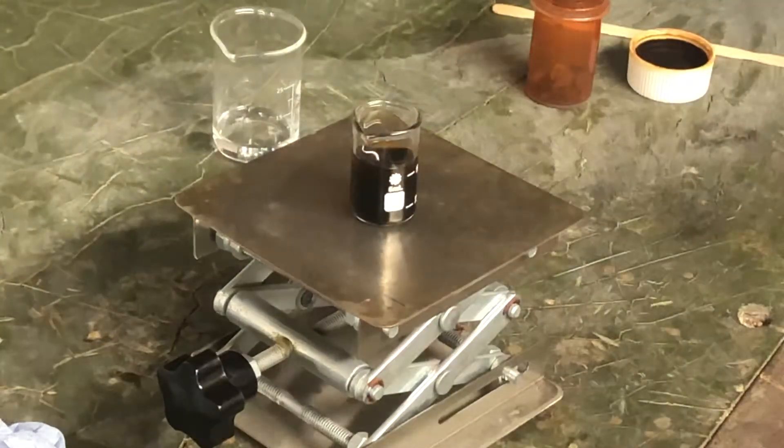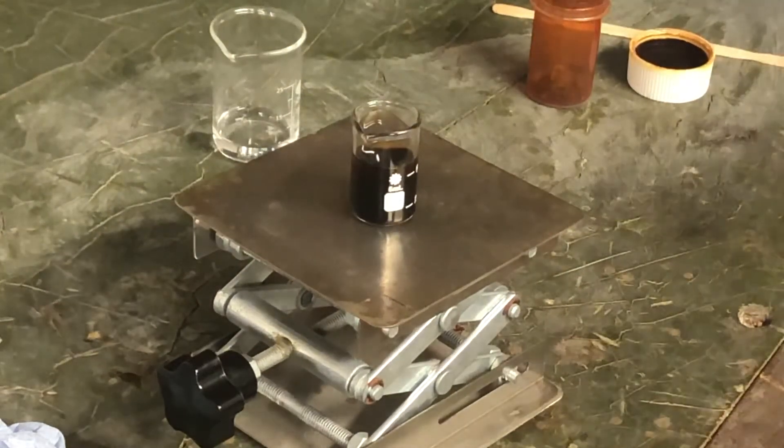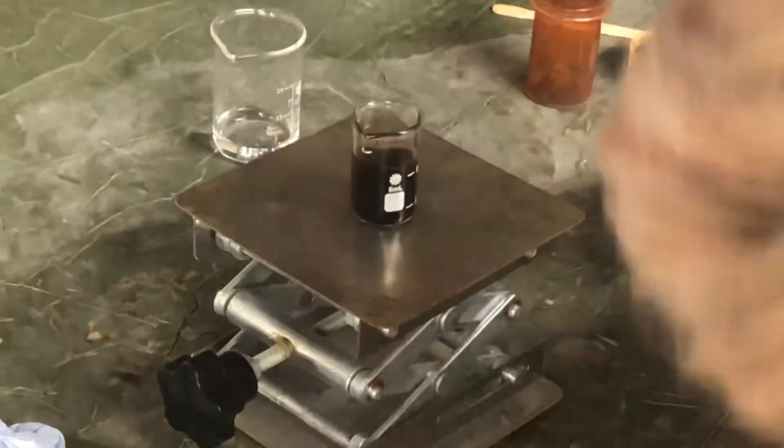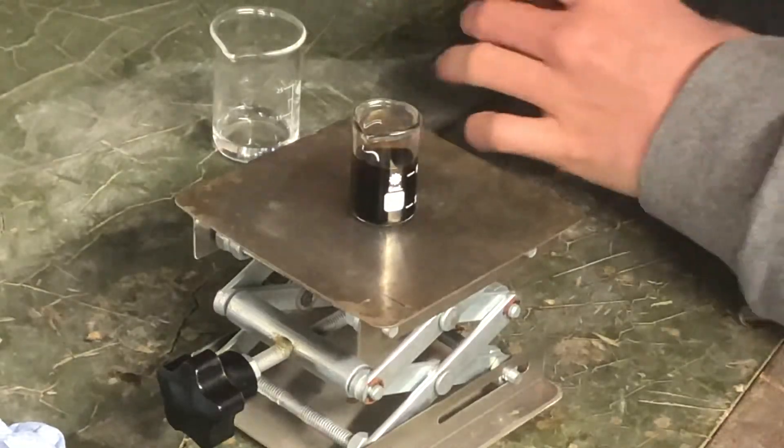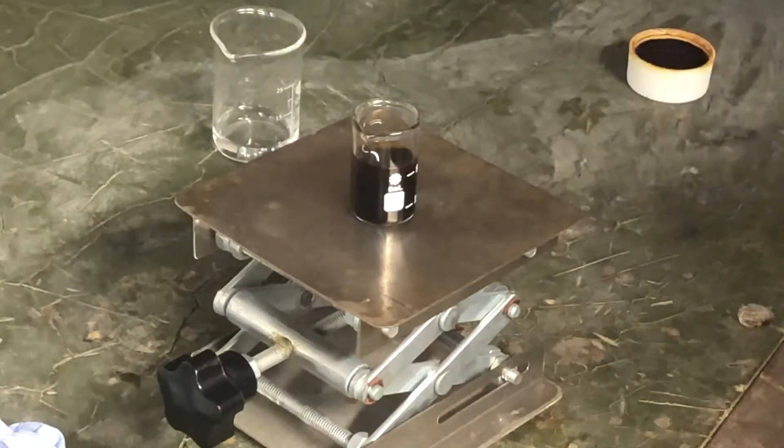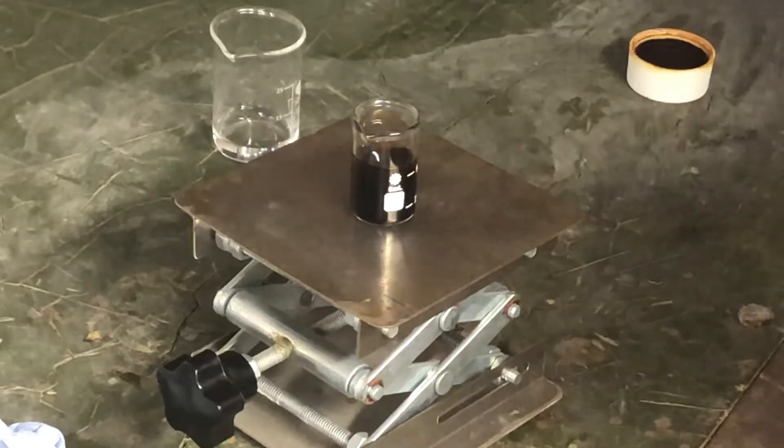I'm not entirely sure if that's visible, but there's definitely a reaction going on, which is very interesting, seeing as there's barely any iodine in there. Let's add some more.